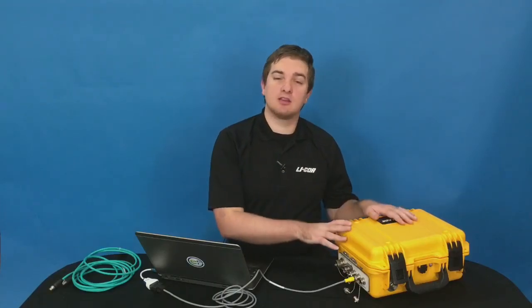Today I'll show you how to use the Windows interface software to connect with and configure the LI-8100A soil flux system. This is Windows interface software, but you're also able to run it on Mac computers with a virtual machine. There are a variety of different ways to communicate between a computer and the instrument. I've detailed that in a separate video. Today I'll show you how to use the RS-232 connection and the Ethernet connection to communicate with the LI-8100 and set it up for soil flux.